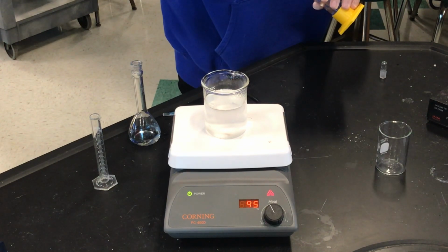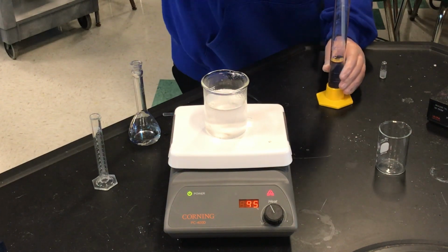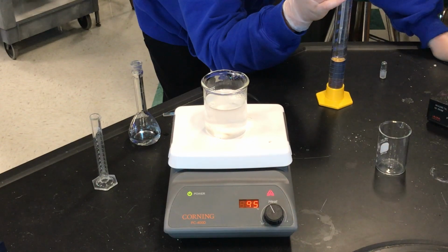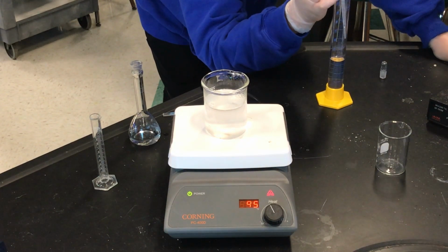And some people would titrate this out of a burette separately. That's probably a little more of a precise way to do it. But if you spend the time and you're doing what student E is doing, you'll get very good results. I expect to be plus or minus 1 percent of the milligram tablet on the bottle here. We expect that whatever Bayer says, 325 per tablet, that's what we're going to get.